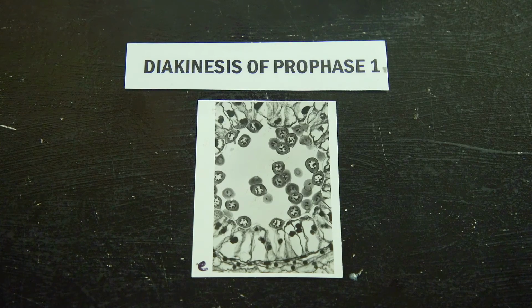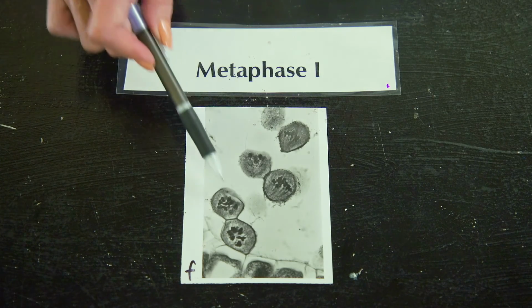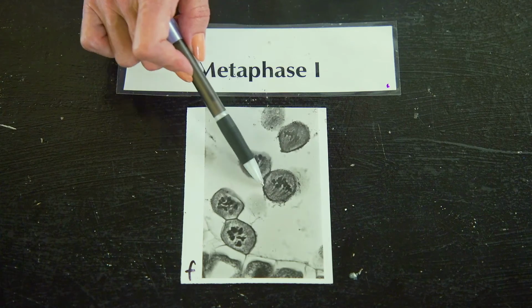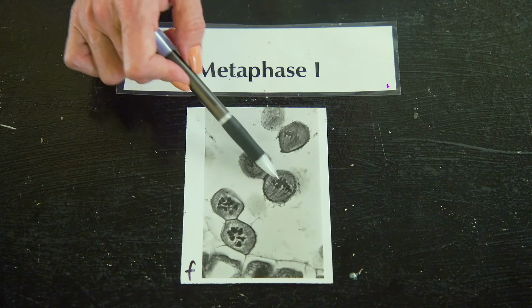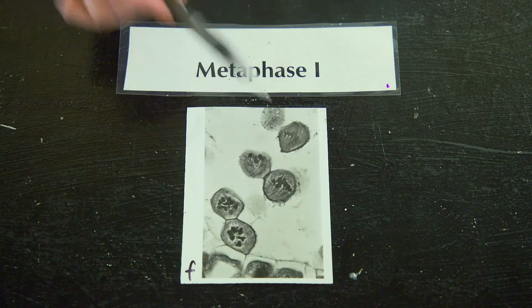And this is the fifth and final stage of prophase 1. It's called diakinesis. At this stage, the chromosomes are at their absolute smallest and getting ready to move on to the next stage. We are now on to metaphase 1, where your homologous chromosomes, called tetrads or bivalents, are getting ready. You can see the spindle fibers are arriving to align themselves on the metaphase plate. You can see it clearly in these 2 cells.